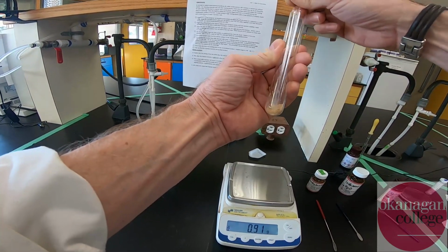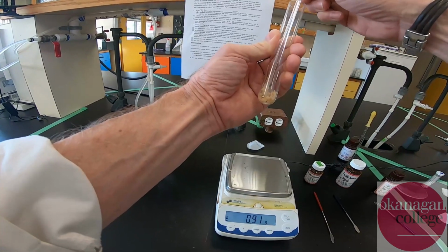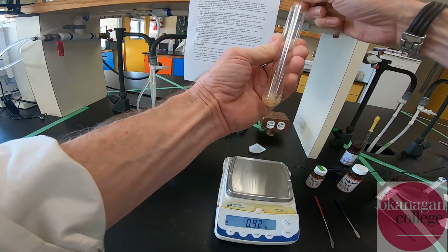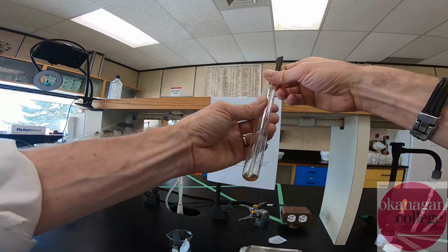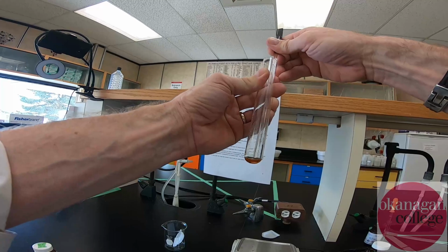So if you've got a melting point of, say, 38 degrees Celsius, and you add a lot of impurity to it, of course the melting point lowers and broadens, and so it becomes a melting point below room temperature. So we've been at it for about 10 minutes now. Hopefully the camera's picking it up.